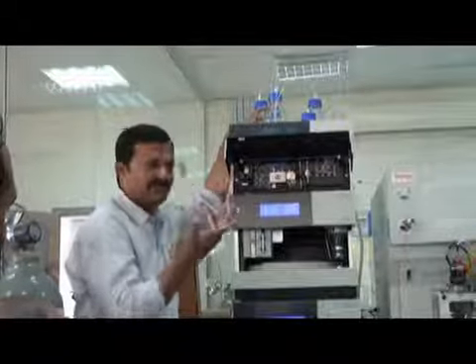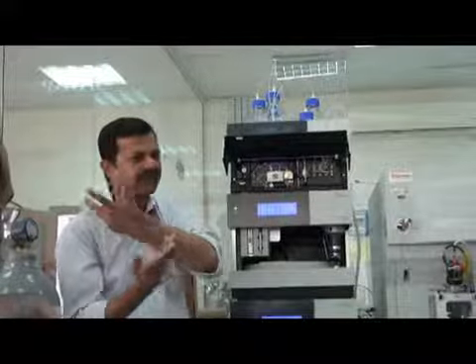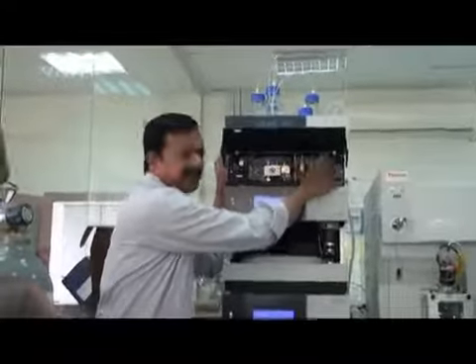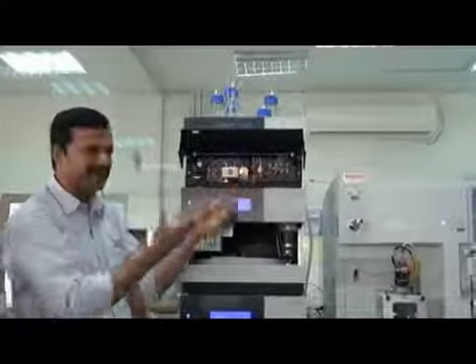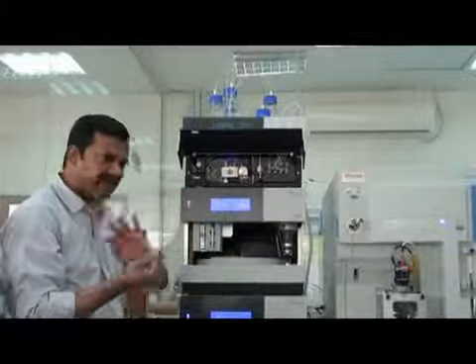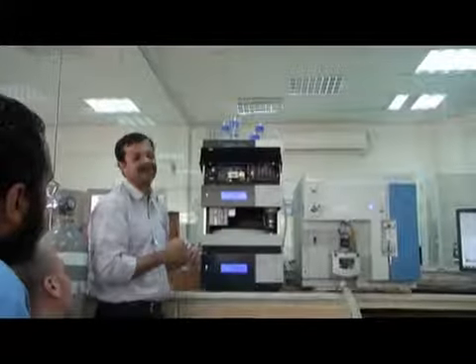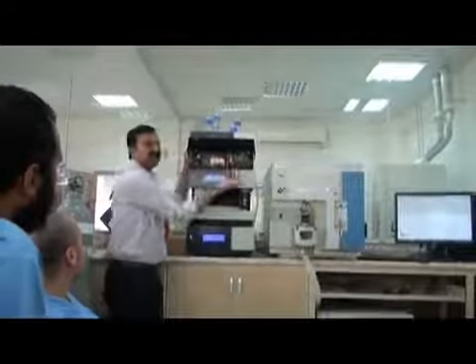There are many ways. You can use an ultrasonic water bath, but this is not very good sonication. So the best thing is to have a device here. This device removes the gases. There is a vacuum inside. It will take out the gases and leave the liquid passing. The liquid will pass, but the gases will be removed. So this is called degassed liquid.